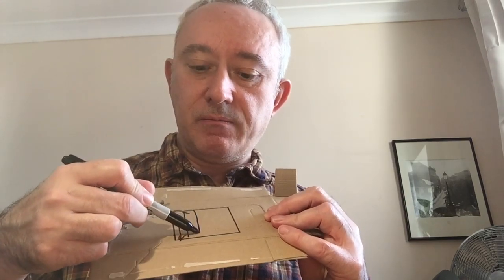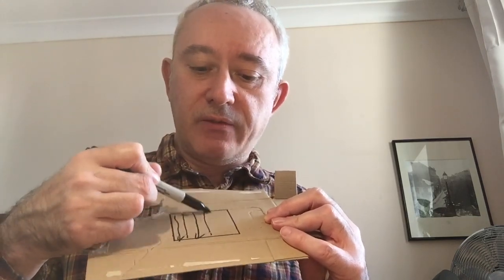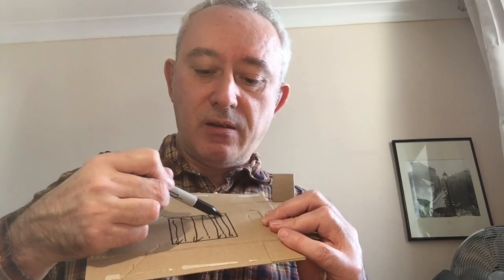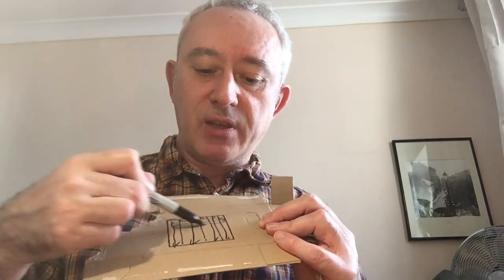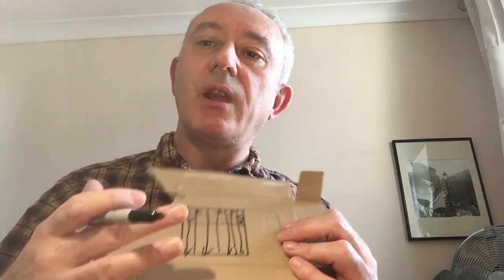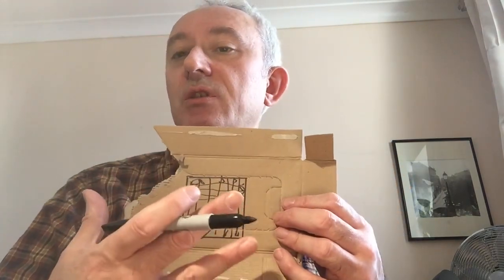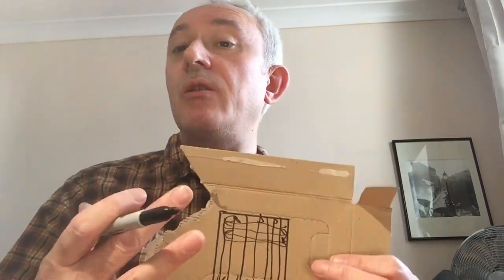You're doing this rolling activity whilst rotating, and then when that is completed you're doing the perpendicular direction for the representative surface. What you're trying to do is to get as many microorganisms as you can and come up with a surface area broadly similar to the size of a contact plate, or at least broadly representative, so that when you find a certain number of microorganisms you have an idea of what that surface bioburden is likely to be.